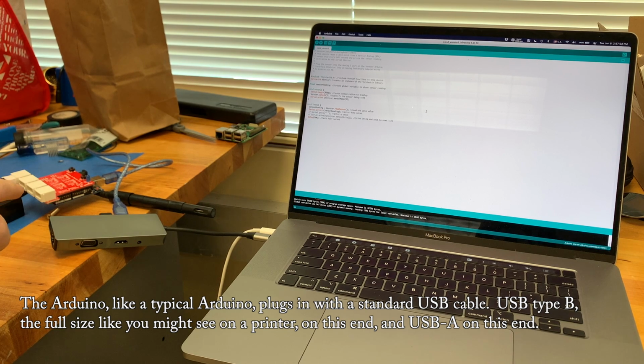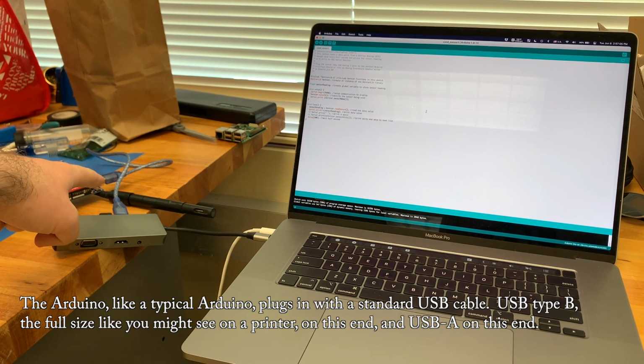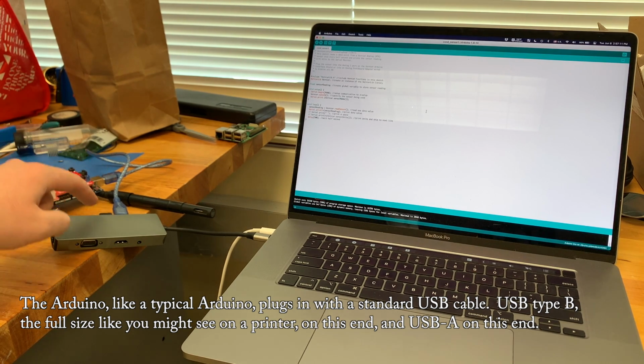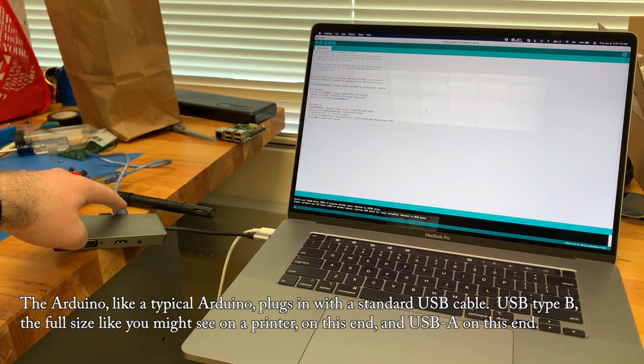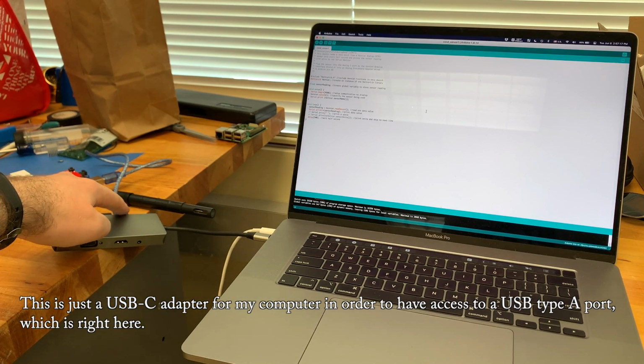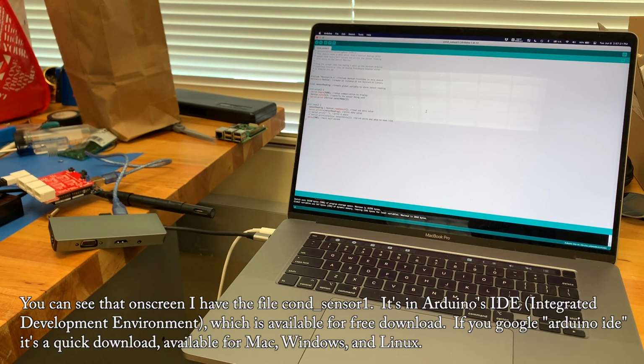The Arduino, like a typical Arduino, plugs in with a standard USB cable, USB type B, the full size like you might see on a printer, on this end, and USB-A on this end. This is just a USB-C adapter for my computer in order to have access to a USB type A port, which is right here.